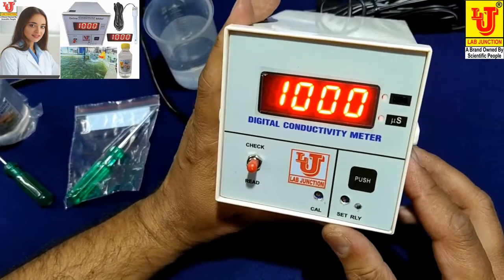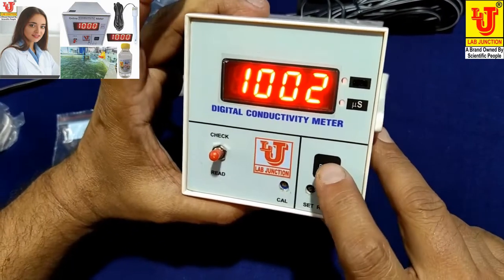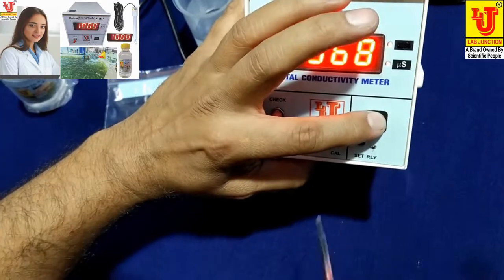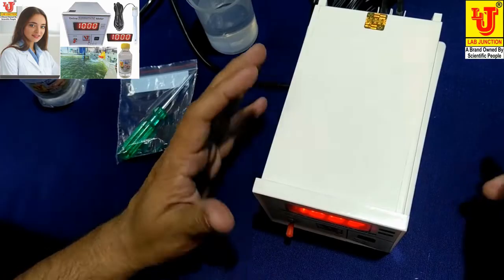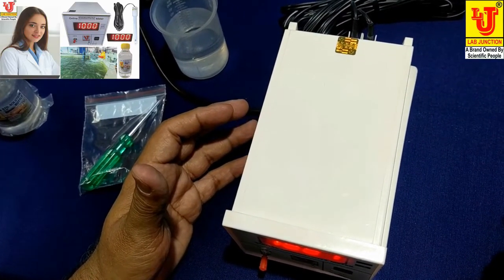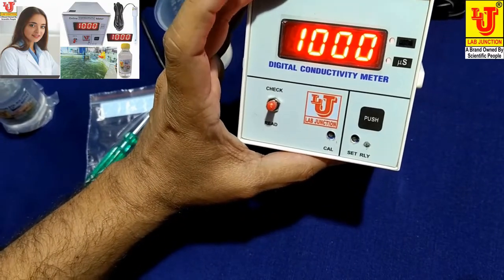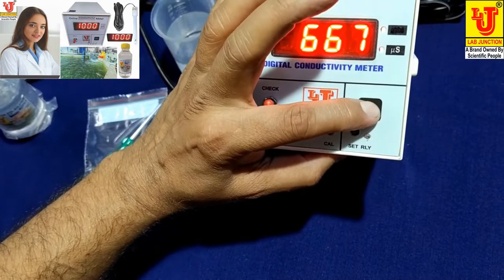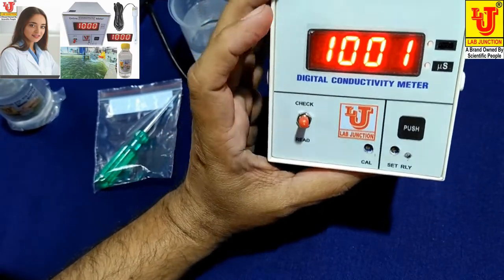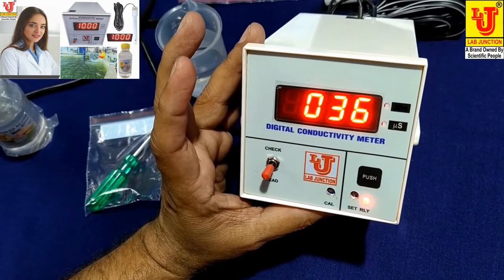Now suppose you want a cutoff value of 300 microsiemens — press this push switch and set the relay value to 300. When your conductivity value reaches above 300, it cuts off automatically. You can set your desired value from the set relay position control. Push it and set your desired value, then go to read mode and your online conductivity reads directly.